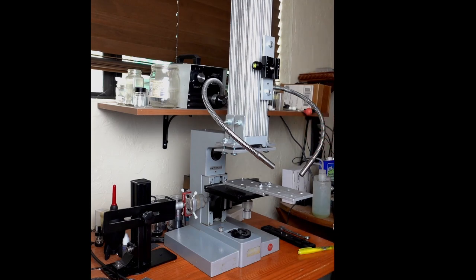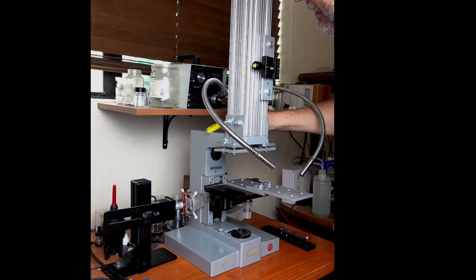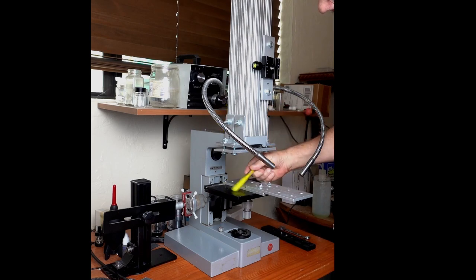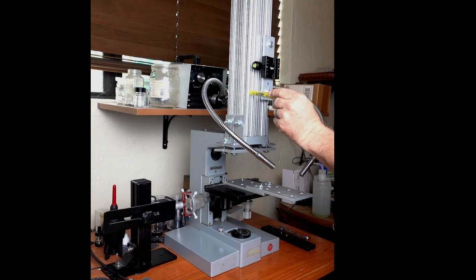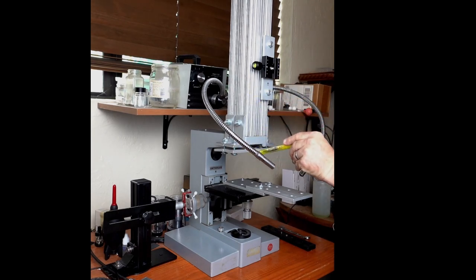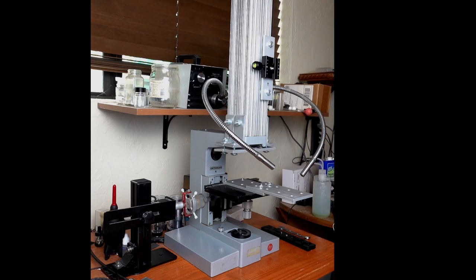In order to mount the camera and the optics over the stage, I chose to take this 3 by 3 inch extruded aluminum block. I initially was going to cut the top of the microscope stand here so I could mount this back here so it would be over the built-in stage. Once I got the stand, I'm like, I don't want to cut it. So I ended up clamping this 3 by 3 inch block to the top end of the microscope stand, and it's on there very securely.